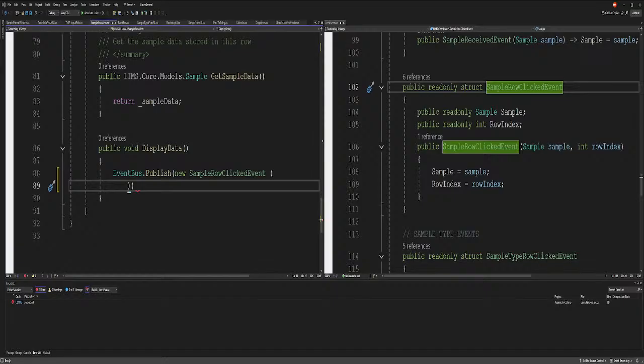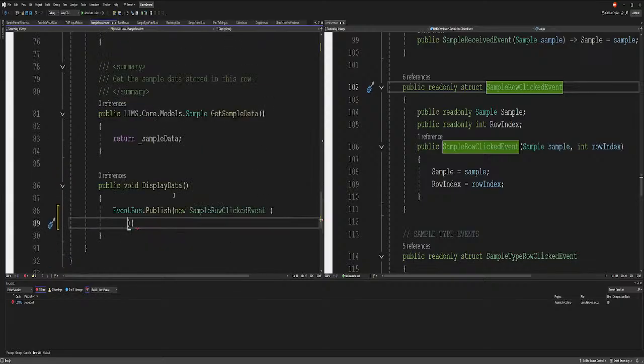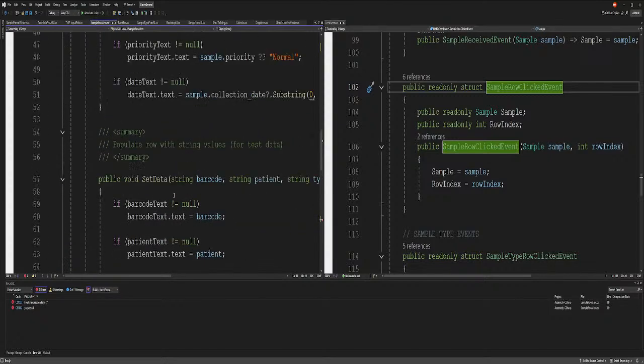Click next. Sample type panel UI. No, that's not right. So sample event, and we need to pass it a sample and a row, right? So sample data. So it says sample data, right? And then we need to pass in the actual index of the set data. Make sure it's correct.